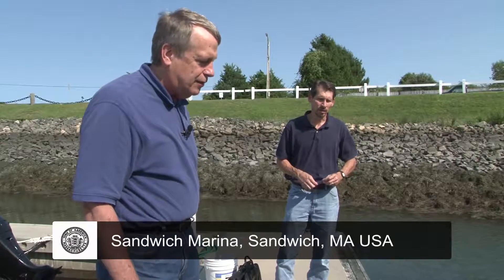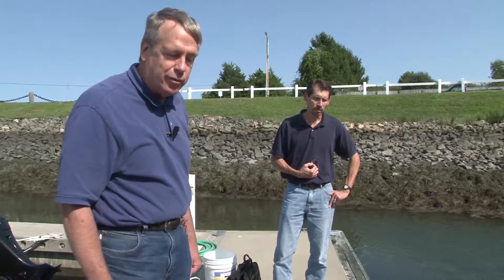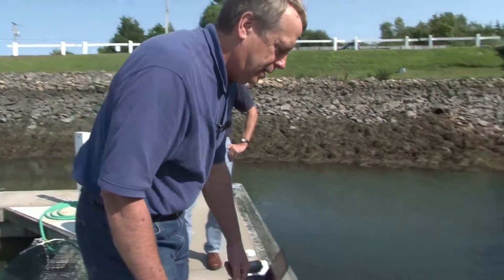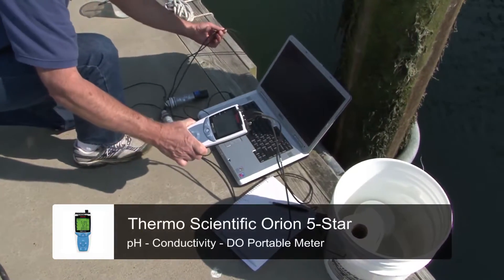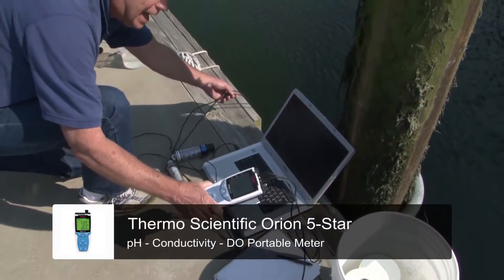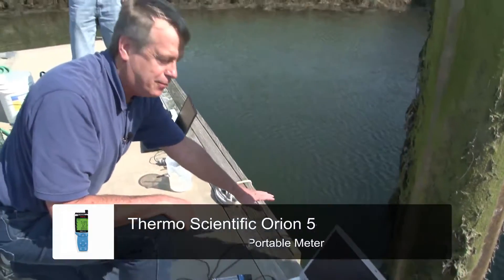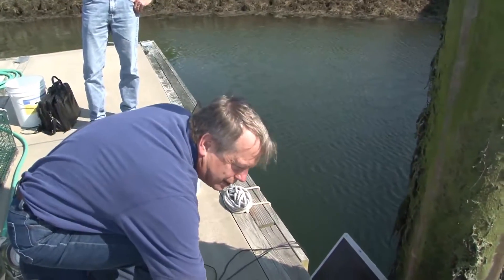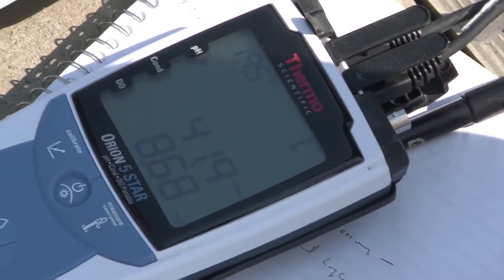We're now at a deployment site where we have loggers in the water, and they've been logging for several months. We're going to first do measurements of the water so that we can do a field calibration. I have installed in the water a DO probe and a conductivity probe from this meter, which allows me to measure dissolved oxygen content and salinity of the water. That's all calculated in the meter. I'll be taking readings from this meter concurrent with the current logging interval going on right now in the water.